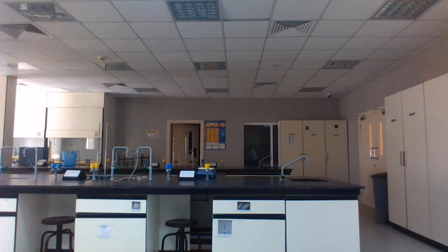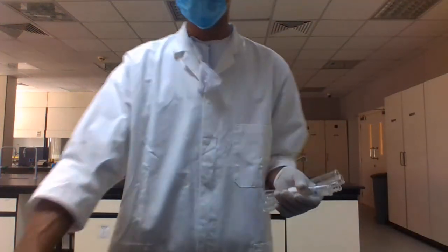After that you have to clean your area and finish. And now we are finishing this experiment.